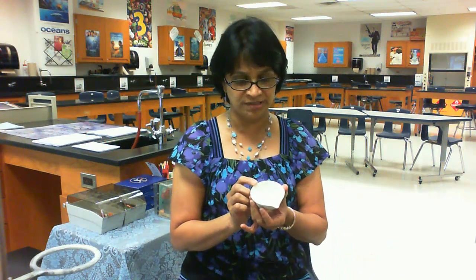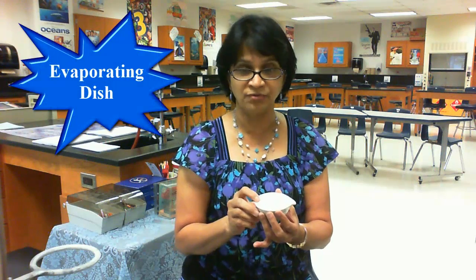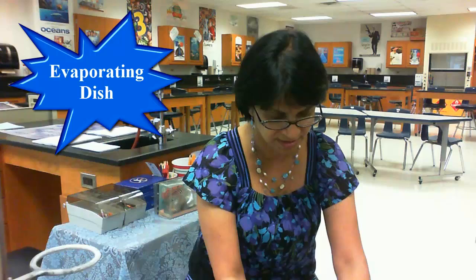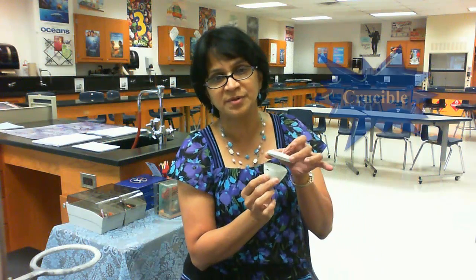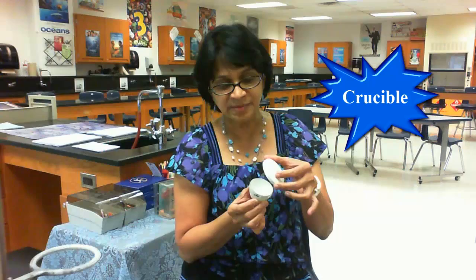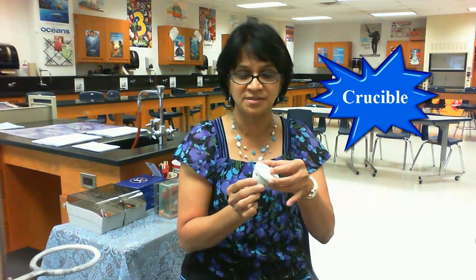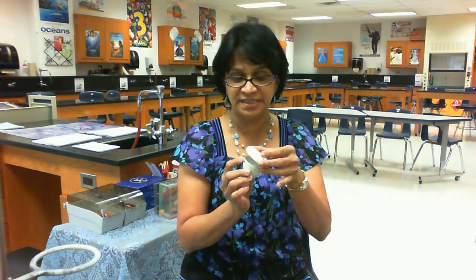We have another equipment called an evaporating dish, which we use for evaporating substances. Then we have a crucible with a lid. A crucible is used for heating substances to very high temperatures and is made of heat-resistant material.